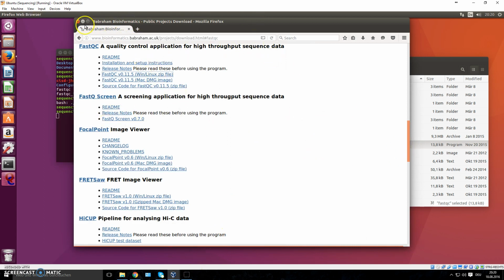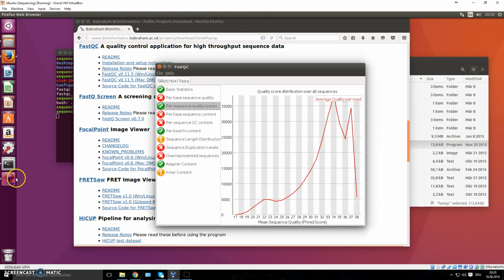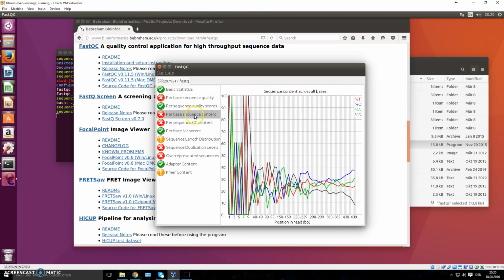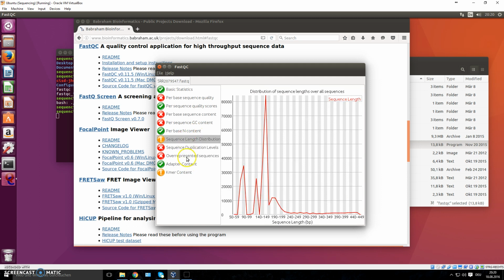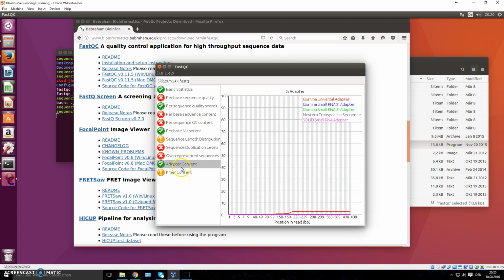But for now, I just wanted to say you know how to execute FastQC, and you can read up on the page what these different things mean. For instance, another thing I can tell you here is adapter content. How much of these sequences might still have these widely used adapters, the Illumina universal adapters, which, if you use an Illumina machine, are usually trimmed right out. So the FastQ files you get are already without adapters.